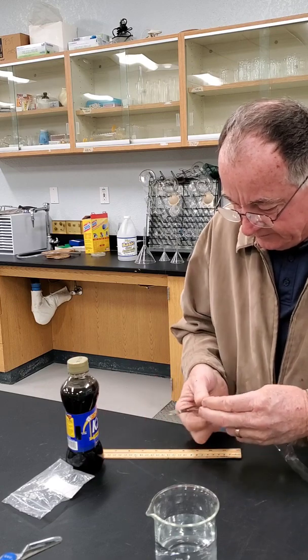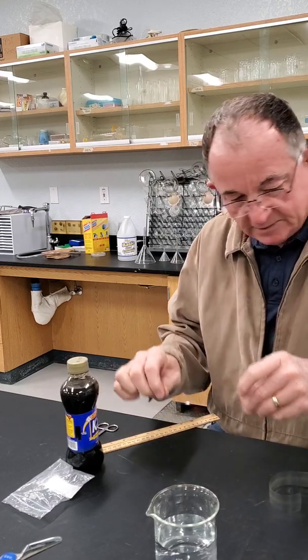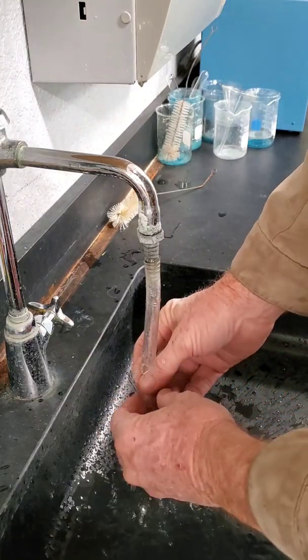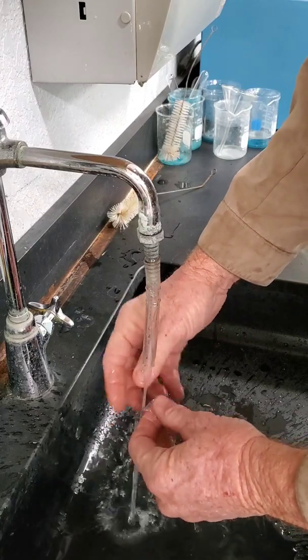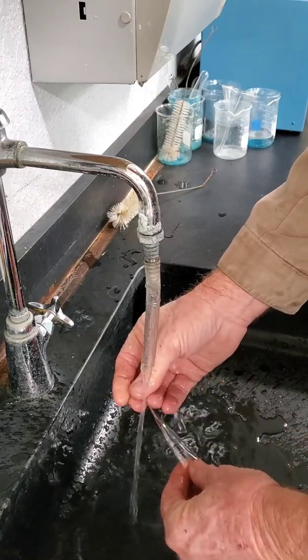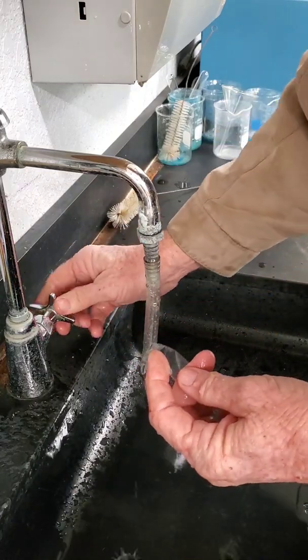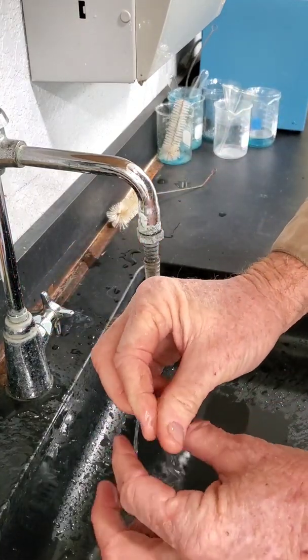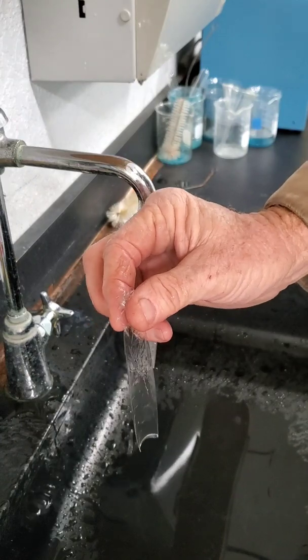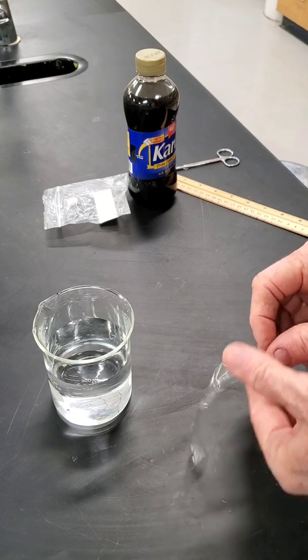We're going to measure out about 15 centimeters of dialysis tubing. We're going to take our dialysis tubing and we're going to get it nice and wet. When we do, it becomes very soft and pliable and we'll be able to rub it and it will slip and we can make a little tube out of it.